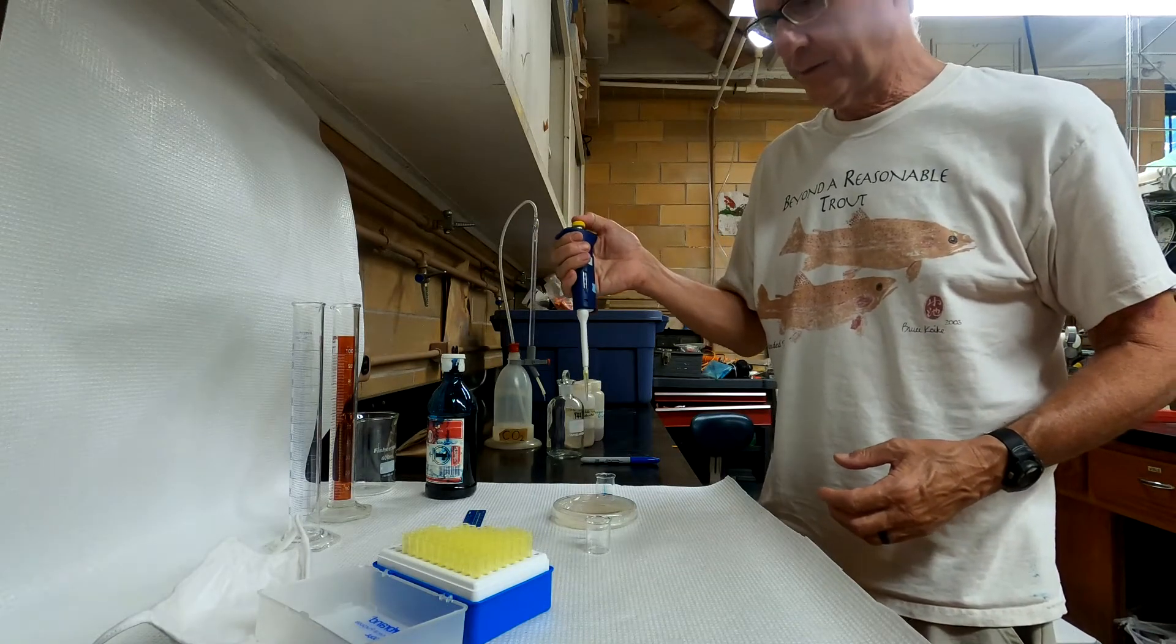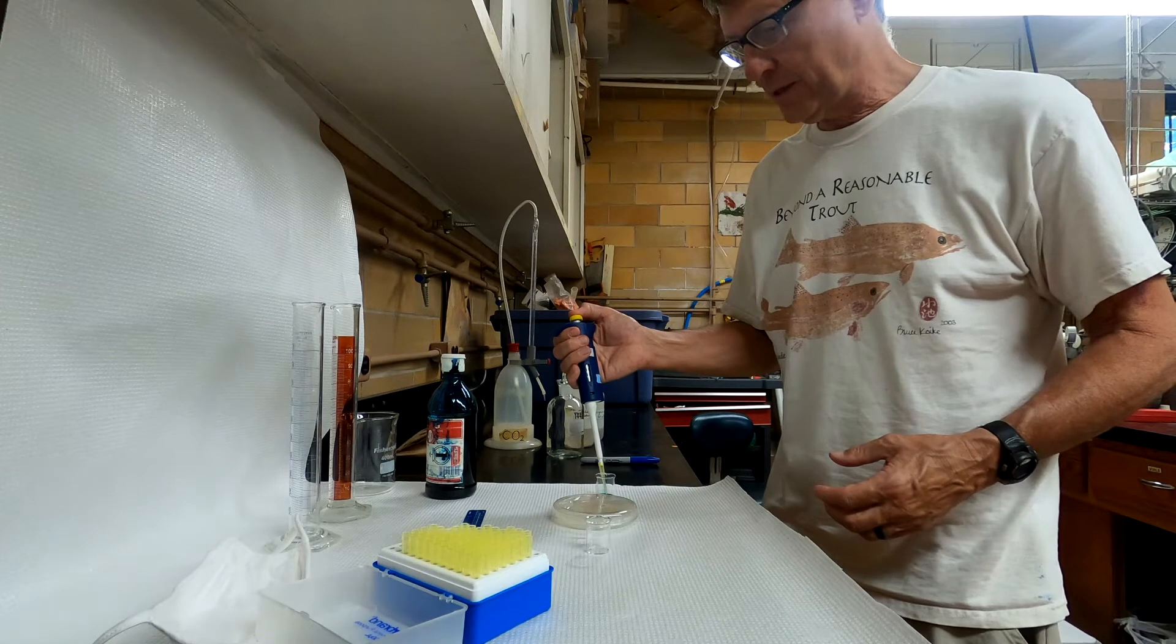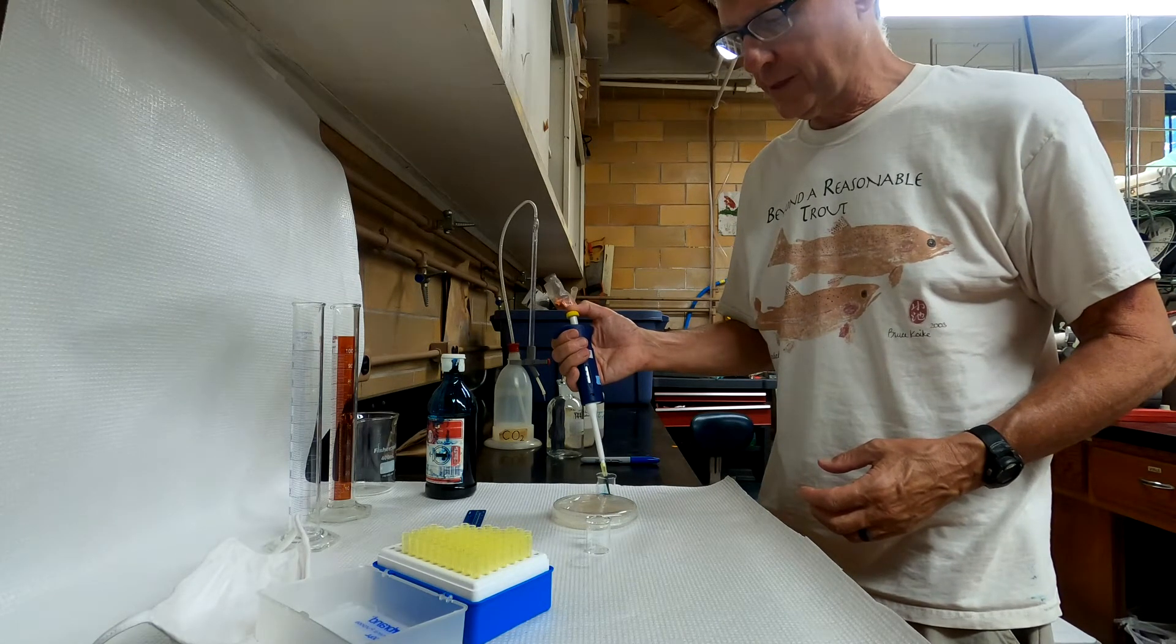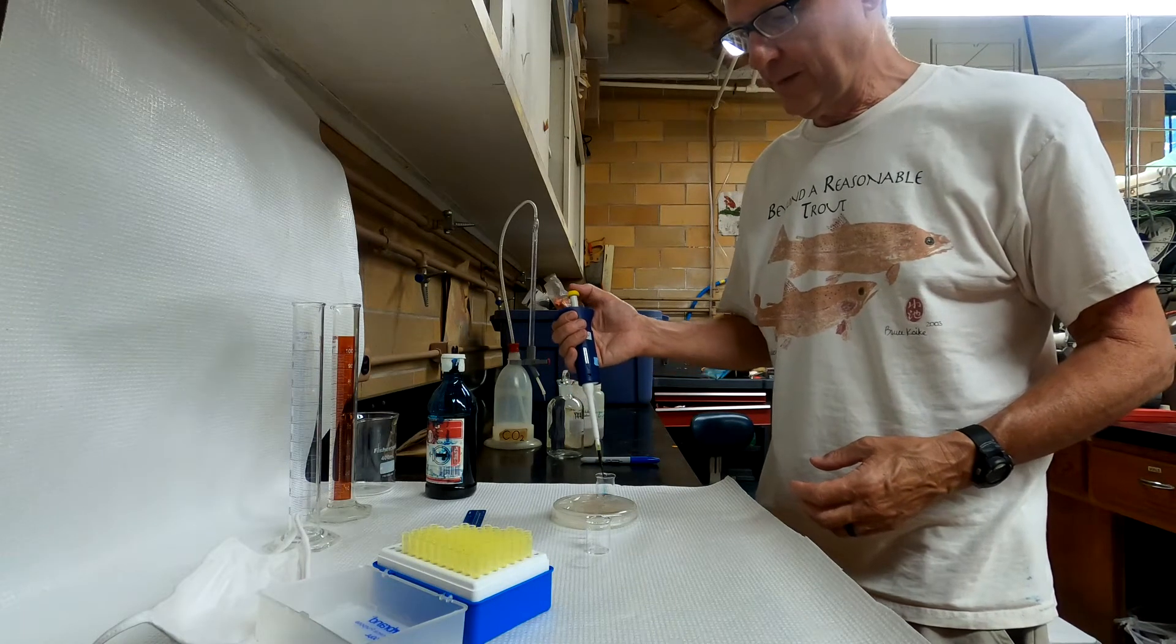When you sample, you want to push it down to the first stop, put the tip under gently, release slowly so you don't pull any air bubbles in, and fill the pipette up.